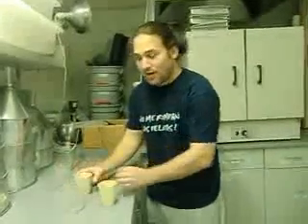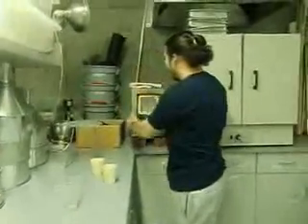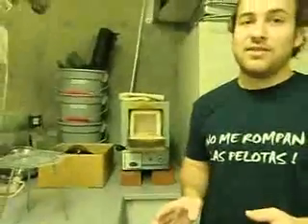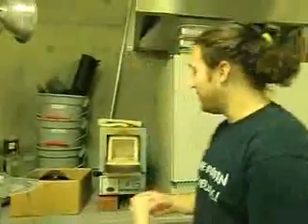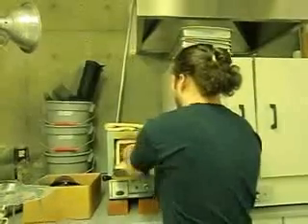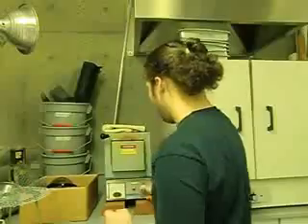What we need these ceramic cups for is we're going to load them into this ridiculously hot oven. When we put it in there, it's going to get up to like 500 degrees Celsius, and this stuff is going to be super hot. Now, you can't really label this because if you put a sticker in there or some tape, it's going to just burn off. So you need to remember which cup is which. I know this one is from the top and this one's from the bottom. Top goes right, bottom goes left. So I'm going to load these in and remember exactly where I put them. And I'm going to turn it on.